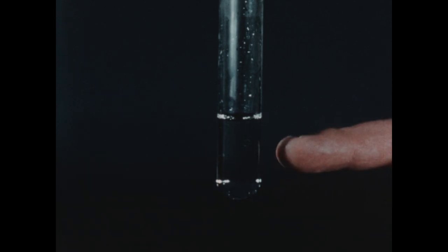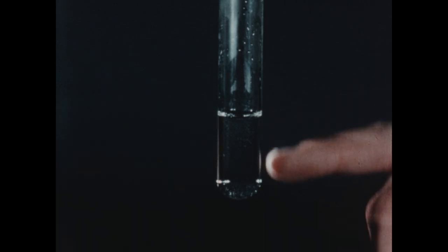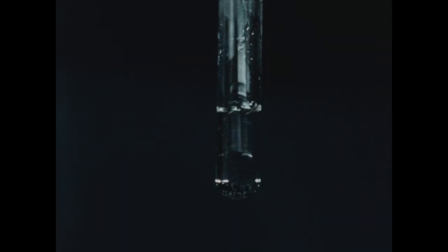In this experiment, we're going to study the influence of temperature on the solubility of a solid solute. In the test tube, we placed a few milliliters of lead acetate solution. And to this tube, I'm going to add 4 drops of dilute hydrochloric acid. Now, in a few seconds, we'll see the appearance of a white crystalline precipitate, lead chloride. I think you can see this precipitate forming in the tube now.